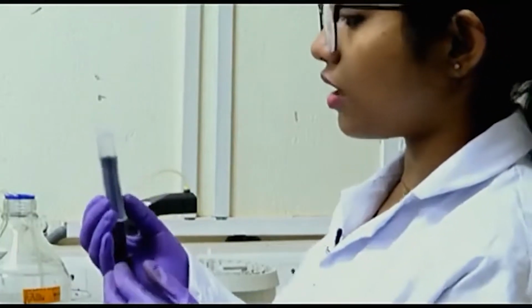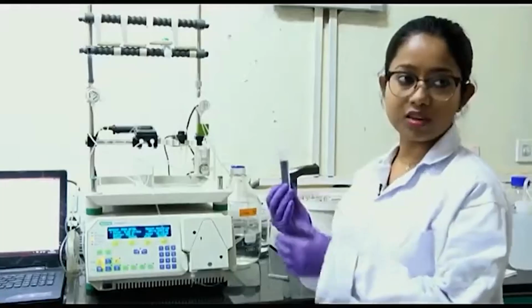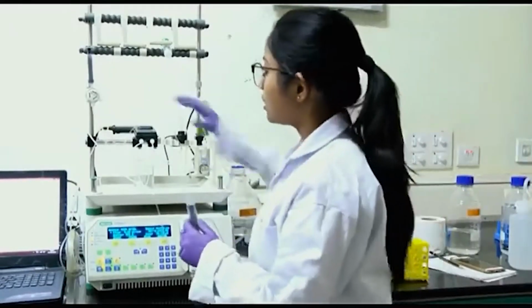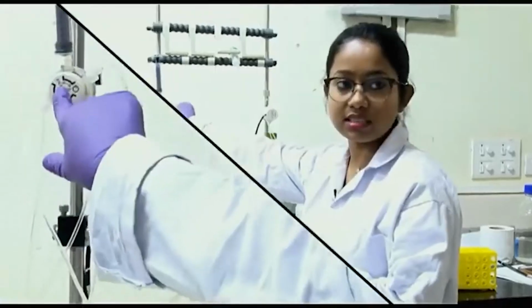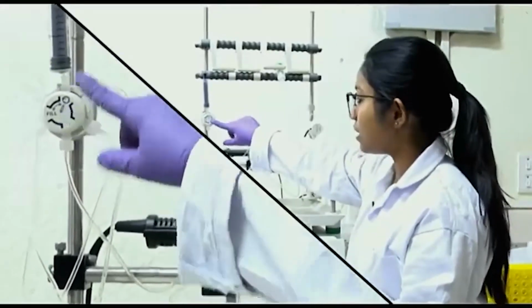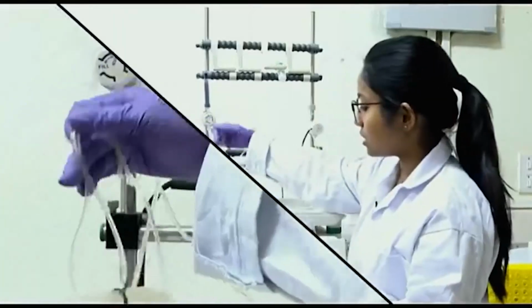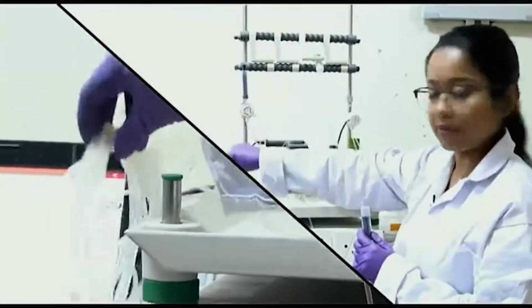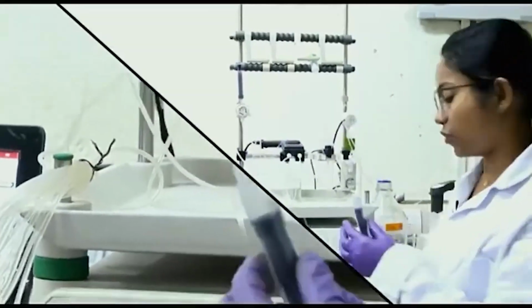So, I have around 5 ml of this sample, where my protein and also other contaminant proteins are present. In the machine, there is a valve with a point where it is marked to inject the sample. This is the position where I will inject my sample, and it will go into a loop. This loop has a volume of 10 ml. Basically I can load up to 10 ml at once, but as I have only 5 ml, I can load it directly in one go.